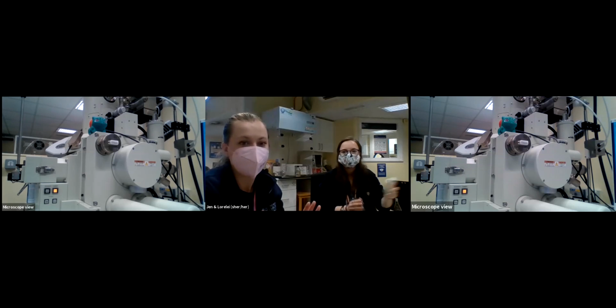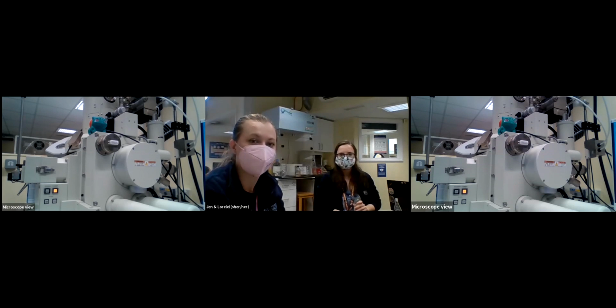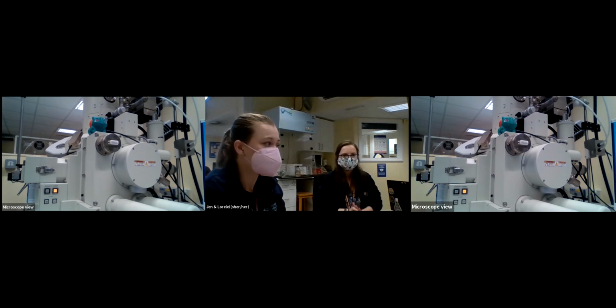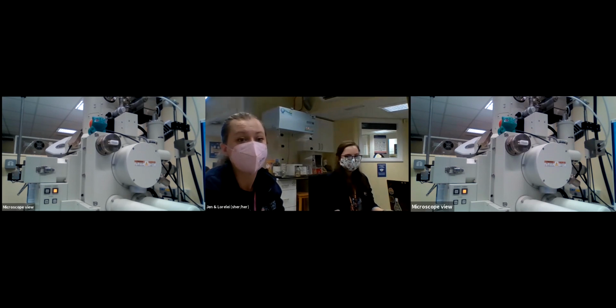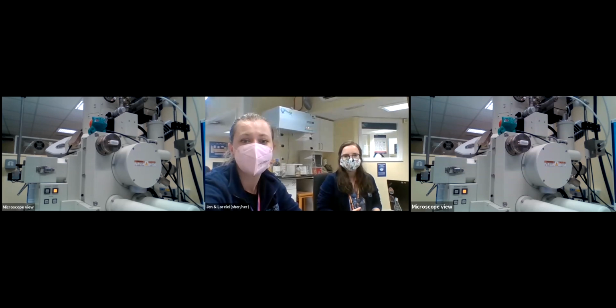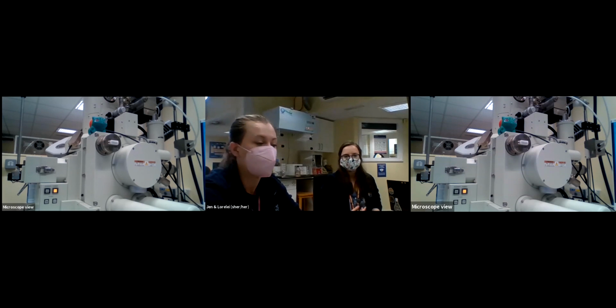We've got a range of fancy detectors, which are all those things plugged into the side that you can see. And they will start reconstructing all the energy, or those X-rays, or the photons that are released by the sample. And they'll reconstruct that into a range of data. So we can look at just the topography of the sample surface, so we can see what shape is happening. If you've got a bumpy sample, that's very useful.